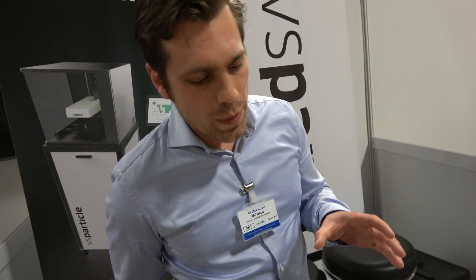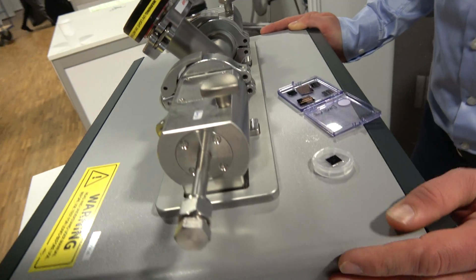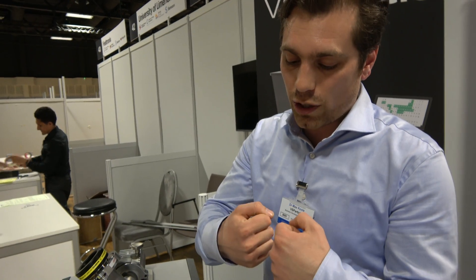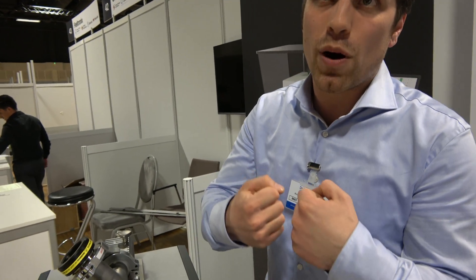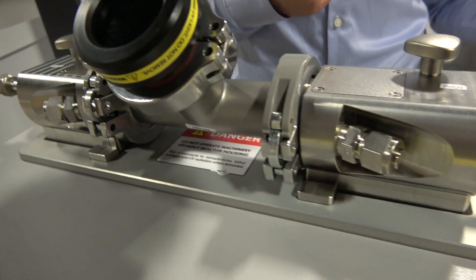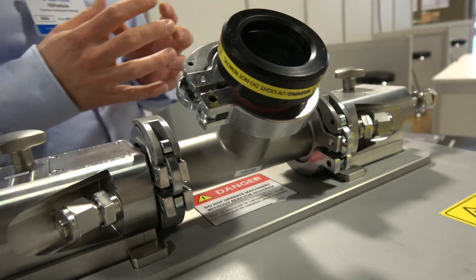So we get rid of the ink. No ink? No ink. Aerosol — what is that? This machine is a nano-aerosol generator. What it does: we have two electrodes. Metal can be any conductive material, as long as it's solid. Between these two electrodes, we put a high voltage and sparks form. These sparks will evaporate the top of the electrodes. At the same time, we have a gas flowing past, and it takes the atoms with it, and they form nanoparticles in the gas.